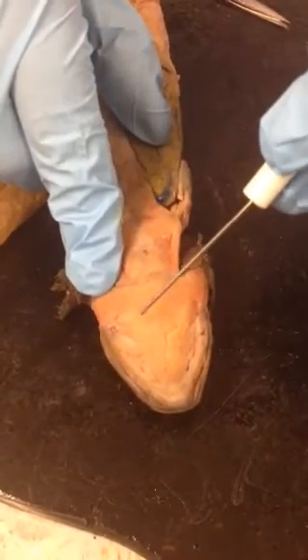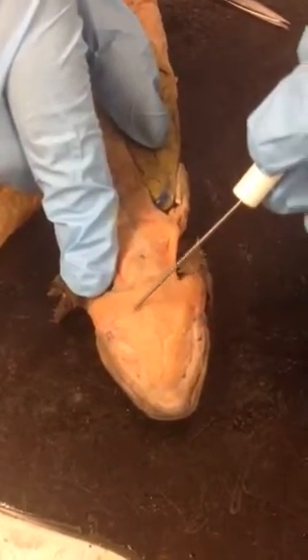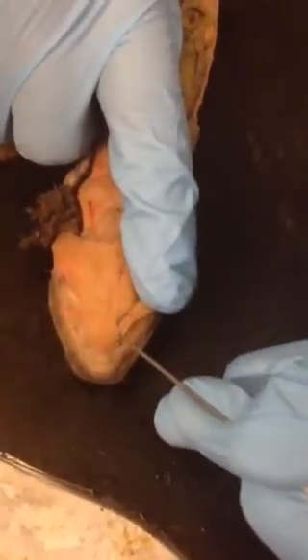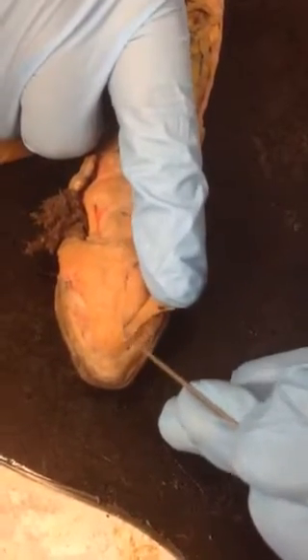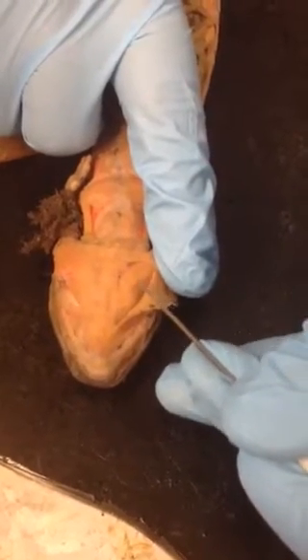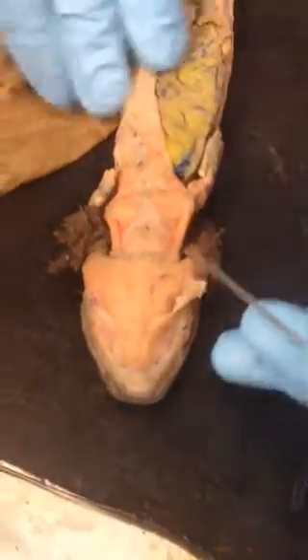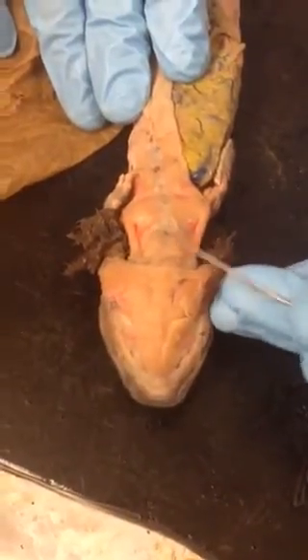Below the intermandibular, you will find the interhyoid, which is basically in this area right here. Now, the deep dissection we did for this guy lets you see two special muscles. The one going down the center is the geniohyoid, and the one to the side is the branchiohyoid. And then we can see here, this is the rectus cervicus area.